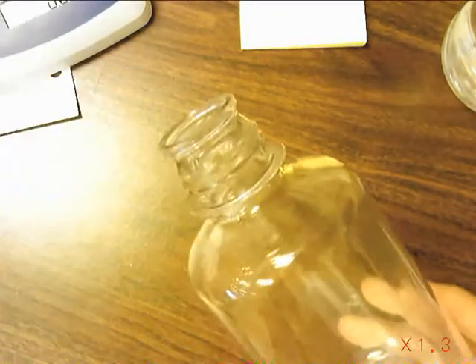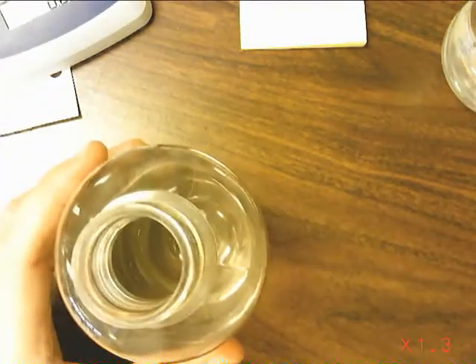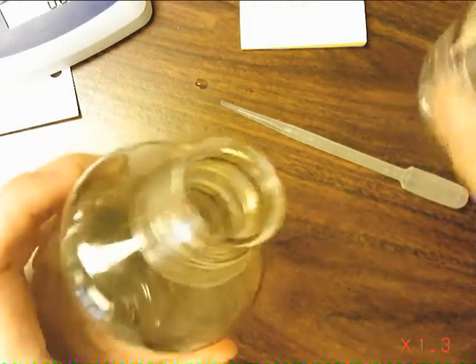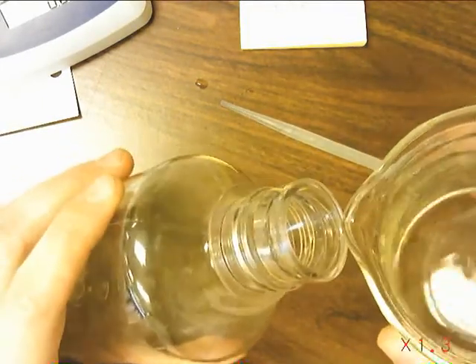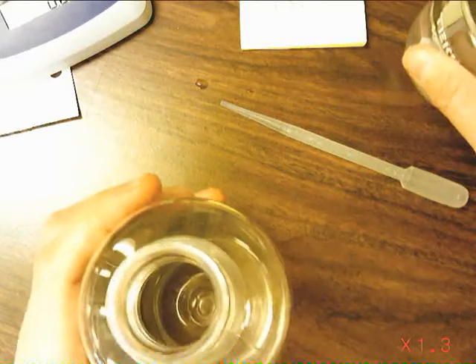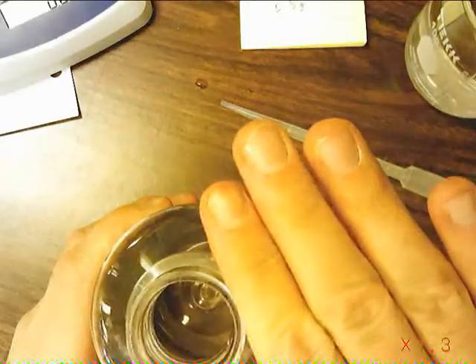The next step of the investigation is a bit tedious, so we'll pretend we're doing it. You allow air back into the bottle, if you wish. And then you go through the painstaking process of very meticulously filling this bottle with water until the water is all the way up to the top.